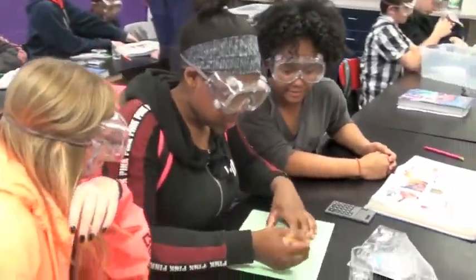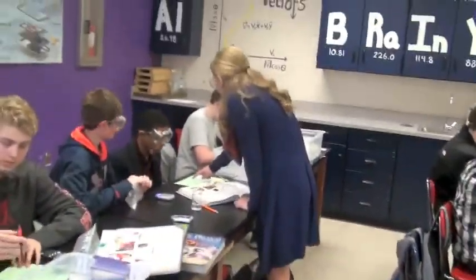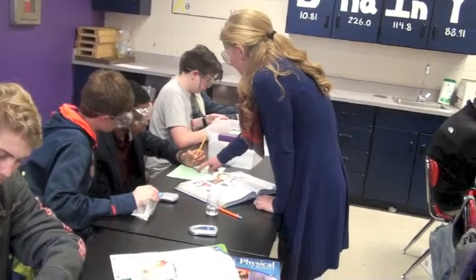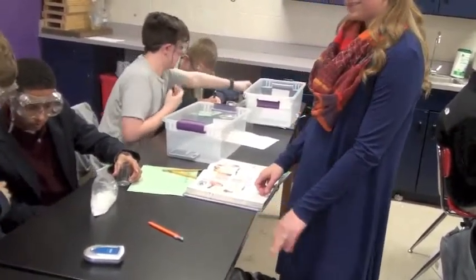So 11.3 plus 3.3. Put it on its side, display it right there, because remember the gas is part of the products.